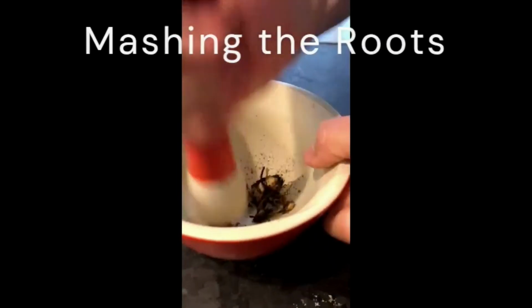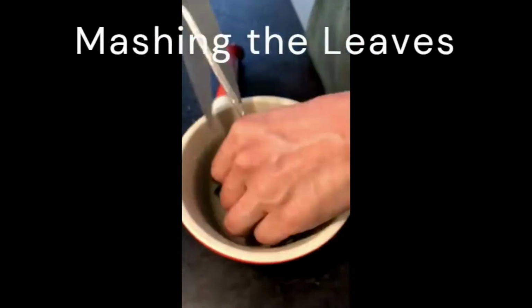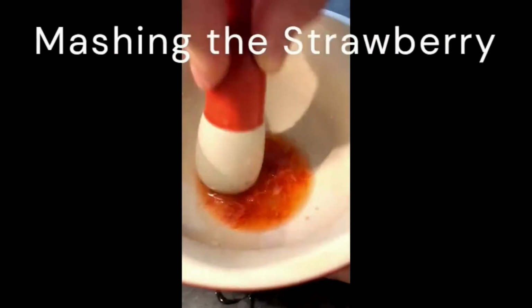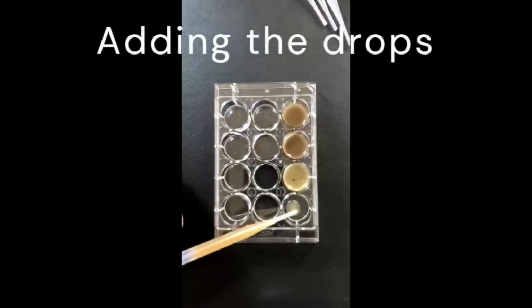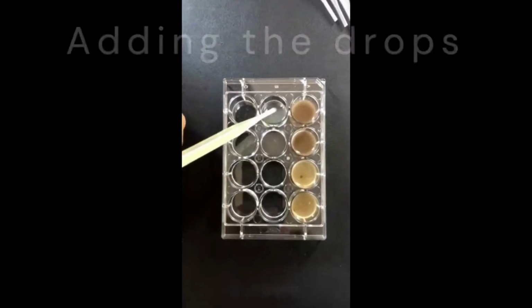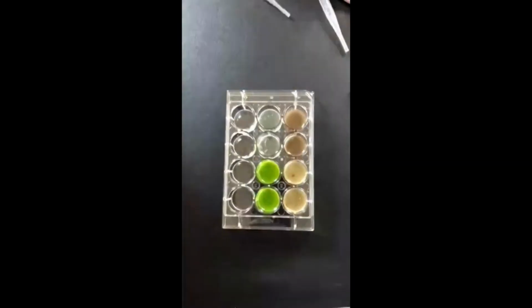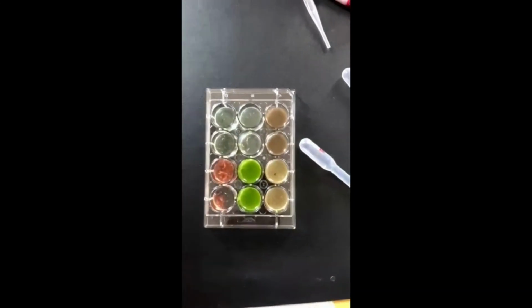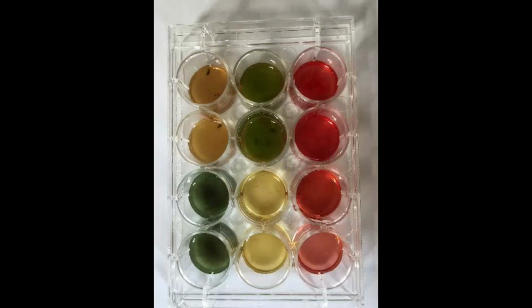For the method, we mashed up the roots, the stem, the leaf, the soil, and the plant and its hull, and we put it in separate containers. We put 20 drops of it in the testing container. Then we put 1 drop of the testing indicator. We waited about 5 seconds for the results, and then we started analyzing.